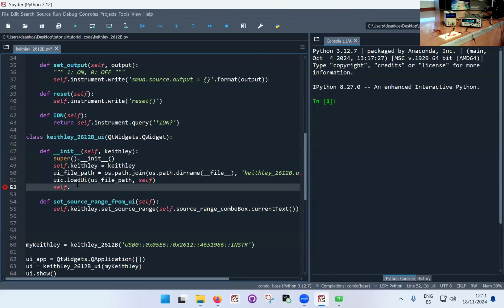object, which, because I loaded the UI, now exists. The only drawback of this process is that Spyder, the interface, doesn't know what's in the other file, so I can't autocomplete. I can't use the tab key to autocomplete, because the Python script here doesn't know that source range combo box is something that exists somewhere else. So that's why I need to copy paste it deliberately. I can't autocomplete as I was doing before.